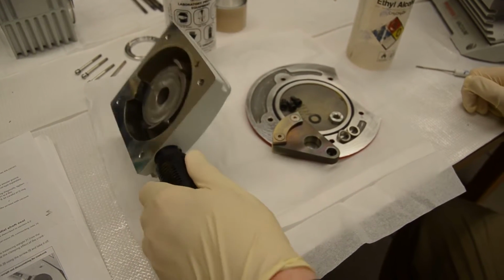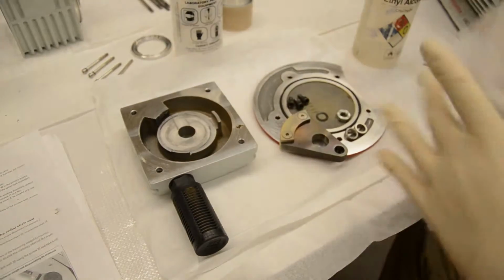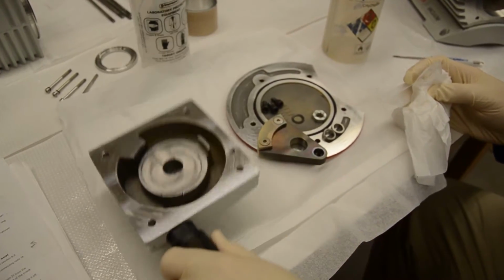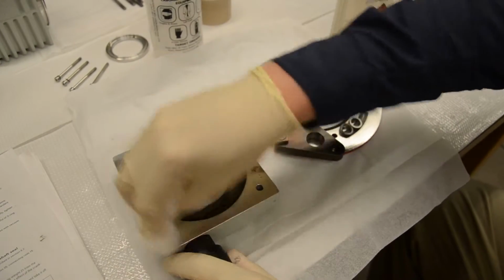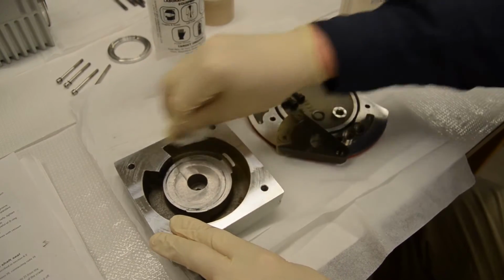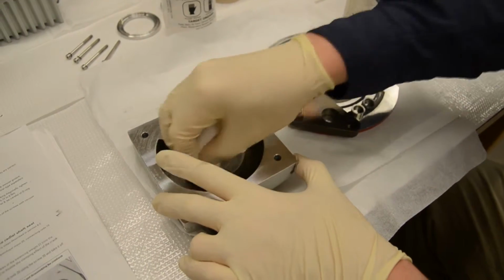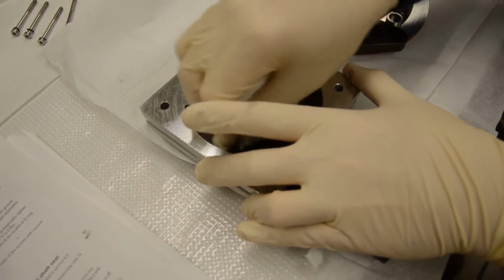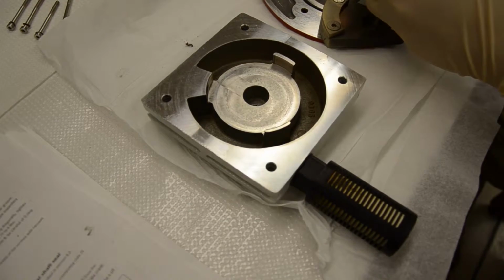Alright, so here we have the atmospheric block top, for lack of a better term. So now we're going to clean this. It's probably going to be one of the easiest items to clean. They're typically not very dirty. Sometimes these do require a little bit of elbow grease. You can see they're getting nice and black.